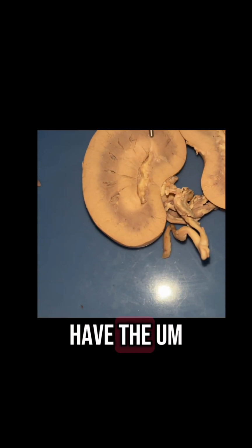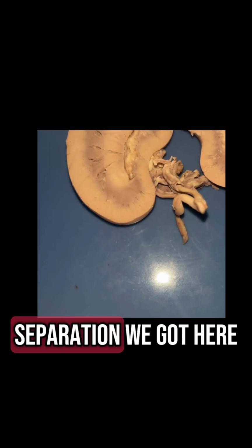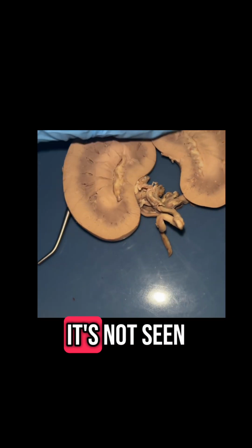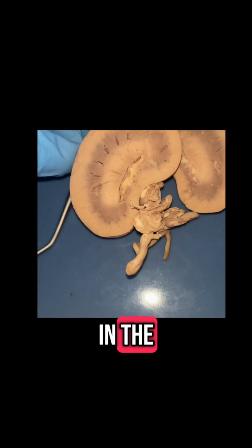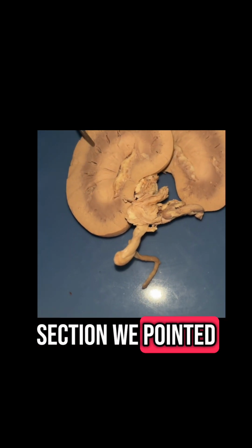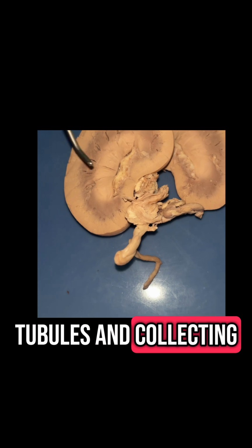Okay, next we have the renal pyramids here. I poked some holes in them so it's easier to see the separation we got here. So the renal pyramids are going to be triangular sections. It's not seen the best on this kidney. They're going to be triangular sections found in the renal medulla, which is the darker section we pointed out earlier. And it's made up of tubules and collecting ducts.